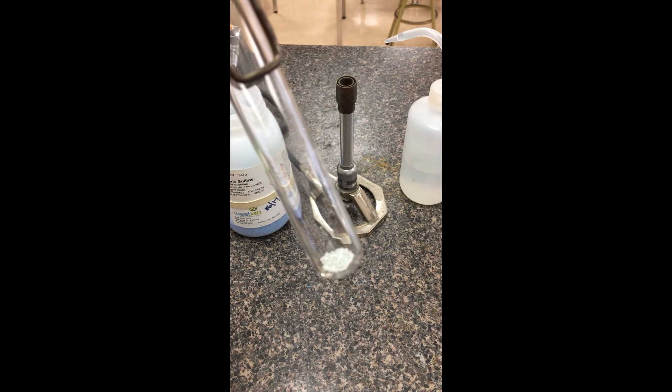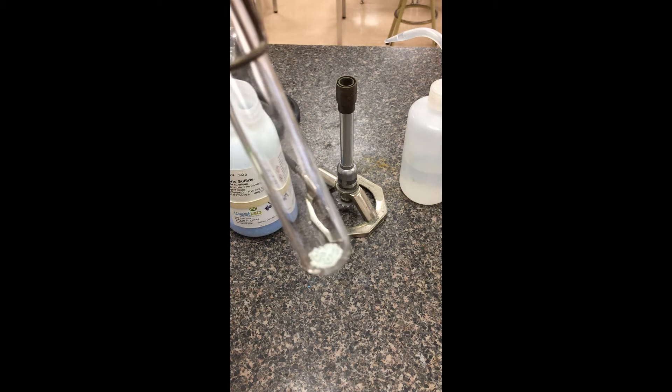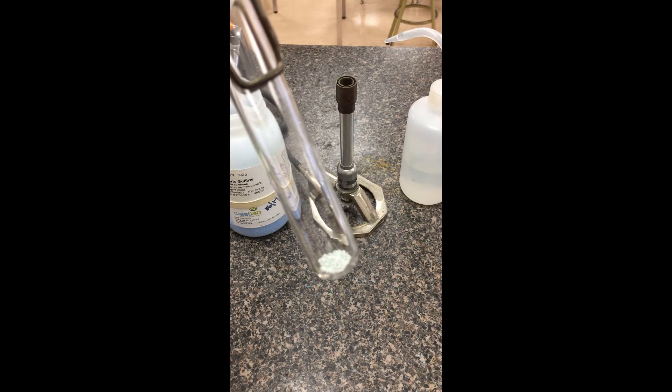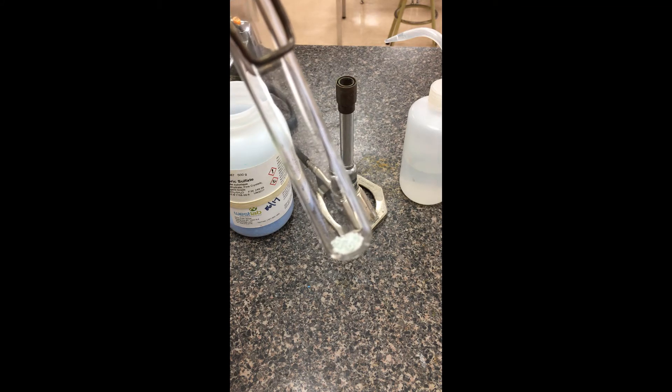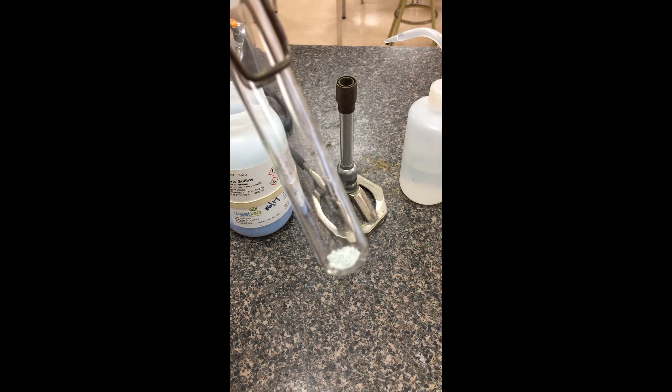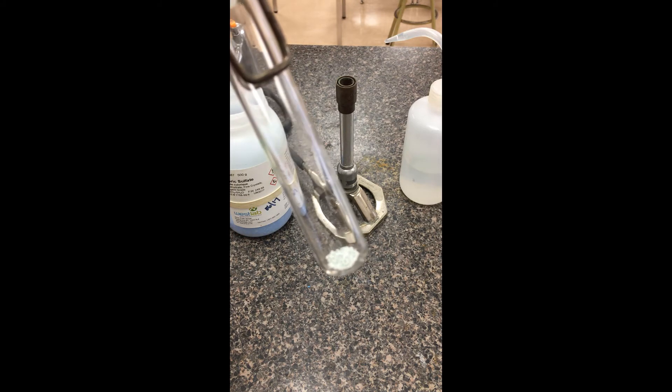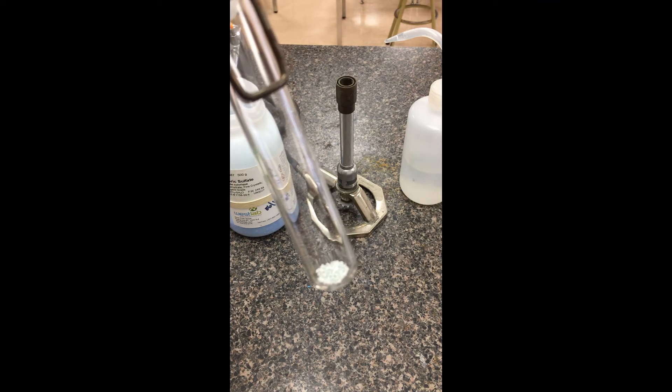As you add water, we're going to focus on mainly what happens to this powder. This powder is soluble, so it actually will end up making a solution. I want us to focus on immediately before that solution happens, what happens to these solid chunks.